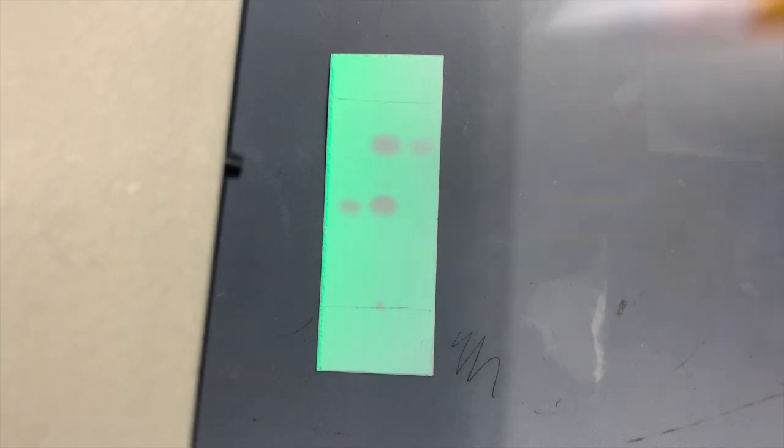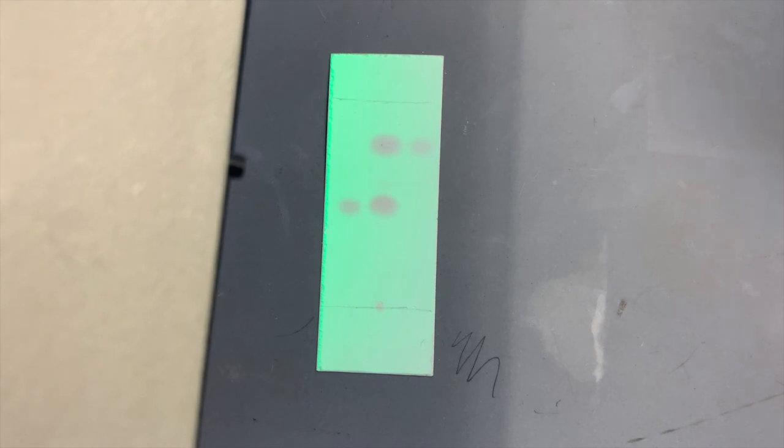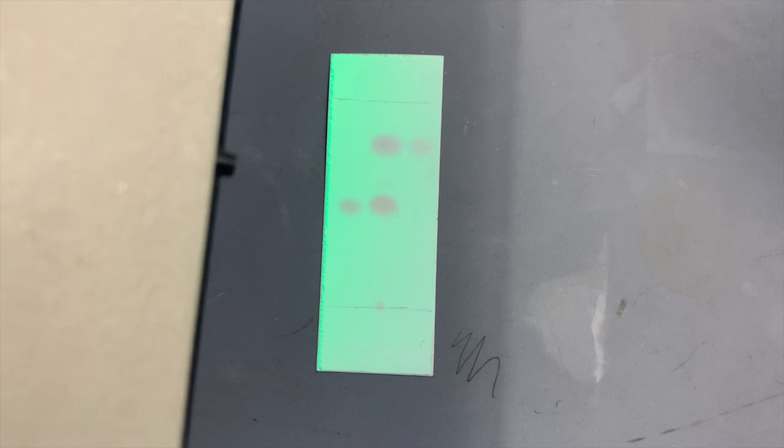So the naphthol remained soluble in water because we had base present, but the product was able to precipitate out. Okay, well, this shows that our reaction gave us a nice pure product after the vacuum filtration, but we still have a substantial amount of unreacted starting material in the reaction, and that's going to definitely lower our percent yield of product.